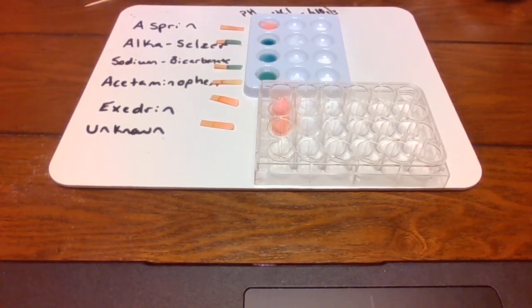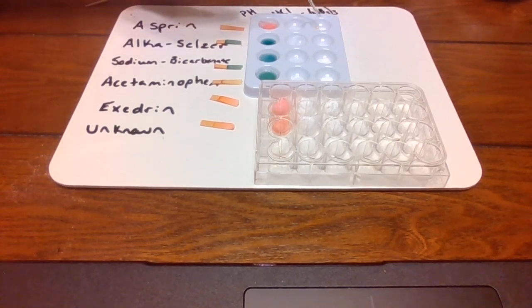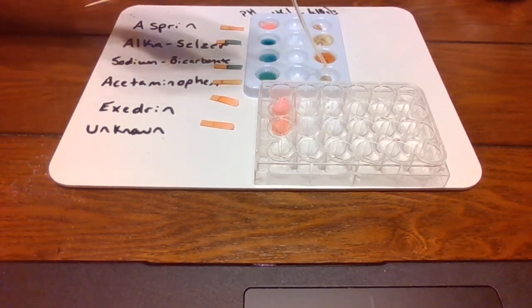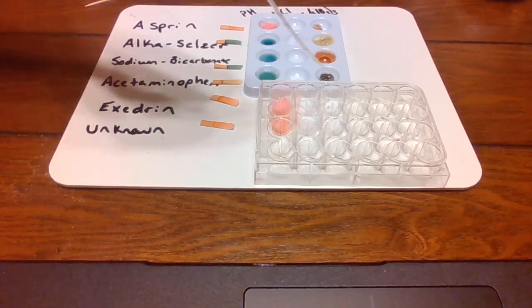All right, the next one is iron nitrate. Mostly iron nitrate is going to be used for a color change. It looks like honey. It does, but we'll see if it turns. Oh, whoa, a lot of fizzing. Whoa, it's yellow. That's red. Jeez. That one's getting dark. It's black, pitch black.